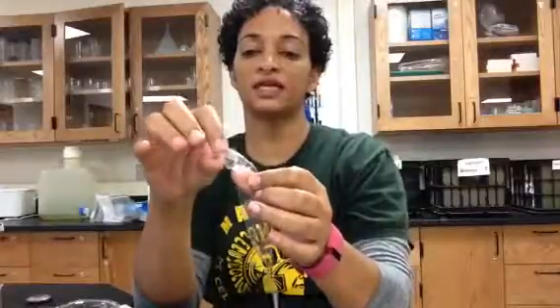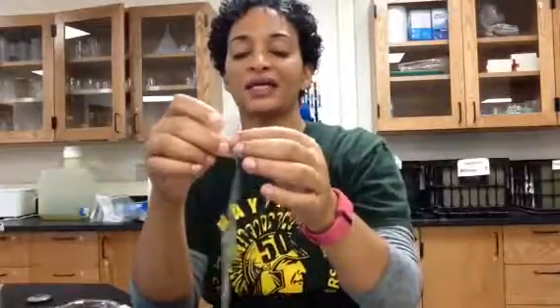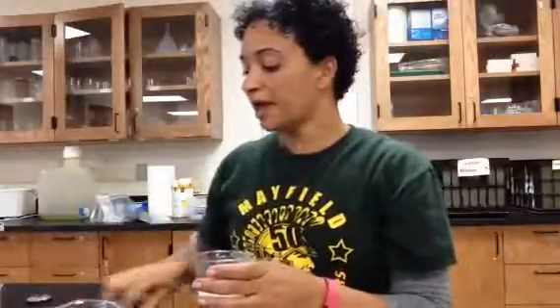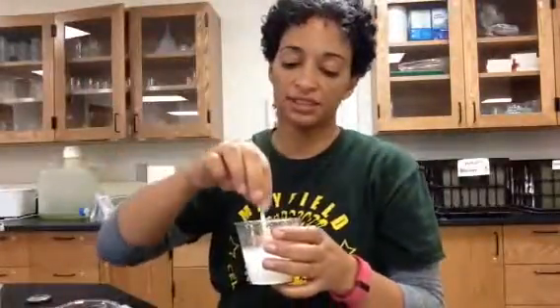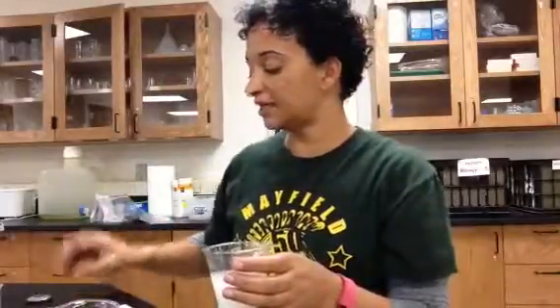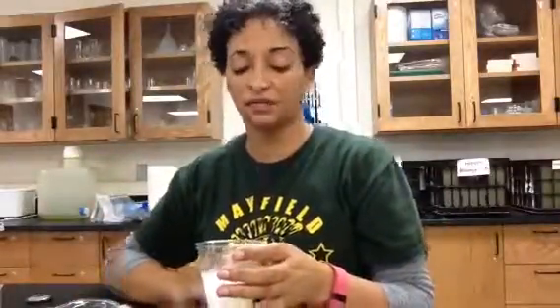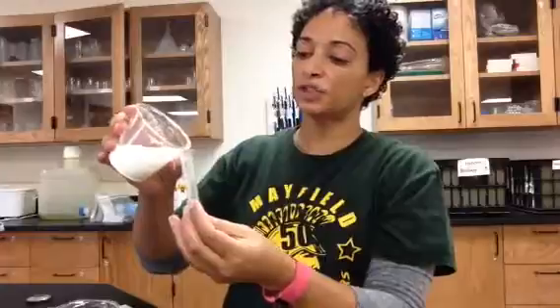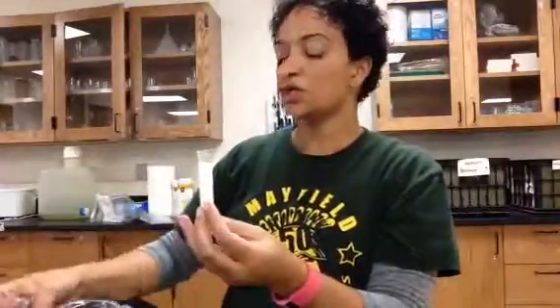Dialysis tubing is kind of like sausage casing — it's actually a hollow tube. To open the other end, I'm going to vigorously rub my fingers together until this end opens. Inside this dialysis tubing, we are going to be putting a glucose-starch mixture. I'll test it for the presence of glucose by dipping my test strip in and setting it aside — it takes about three minutes to change. I'm going to measure out 10 milliliters of this glucose-starch mixture using a graduated cylinder. You may need to swish it around a little bit, as the starch tends to settle to the bottom.